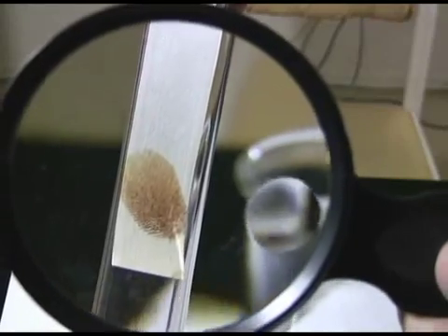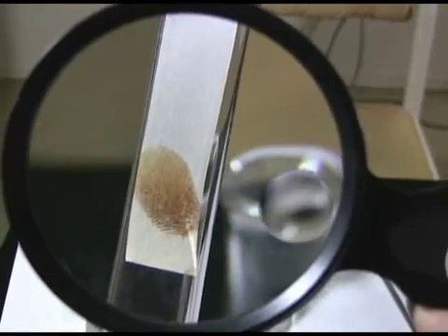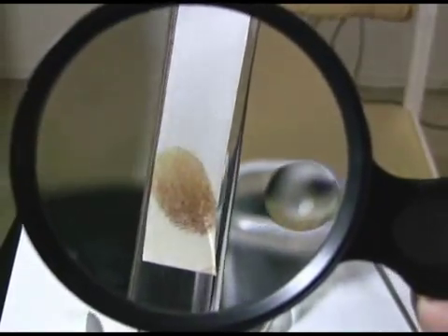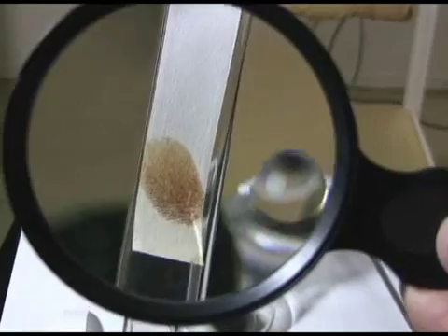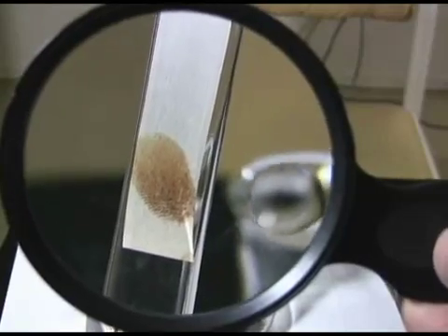You may be wondering why the paper didn't turn brown — that's because paper is polar, if you know a little chemistry. But iodine and fat are non-polar, so the iodine really only goes onto the fatty parts of the fingerprint. So there you go — another technique to view fingerprints. Hope you enjoyed this. See you again soon.